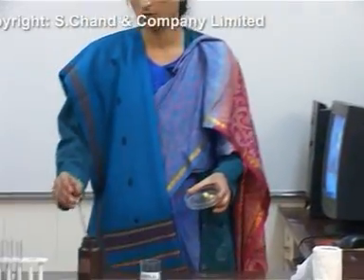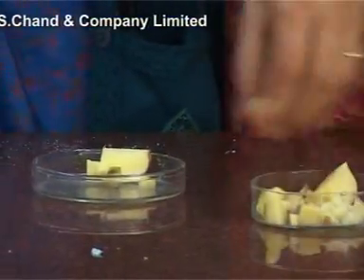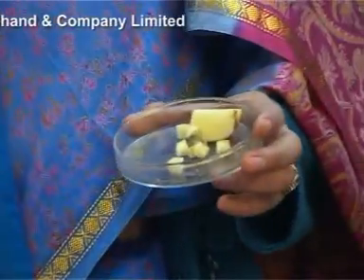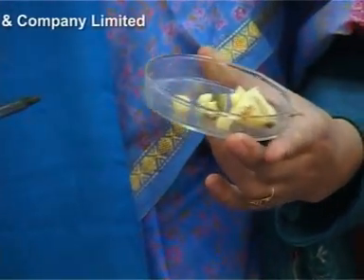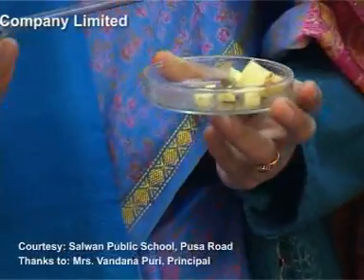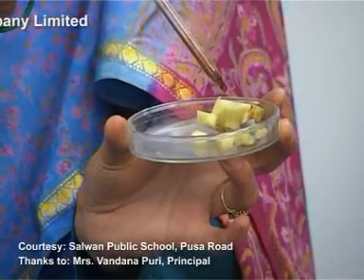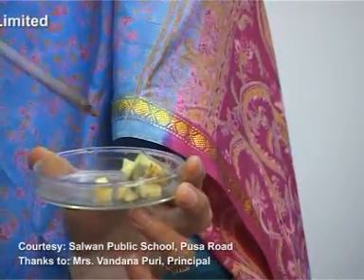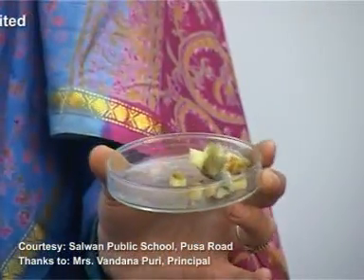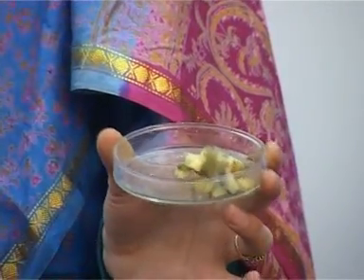Now here is the food sample. On this we put a drop of iodine solution and you can see how it will change its color. You were able to observe the change in color. This side also you can see. Can you see the change in color? I can repeat it just one more time. After some time you can see that the whole potato will change into black color. You can see the change in color very clearly as it reacts. As the starch reacts with the iodine, the blue-black color appears.